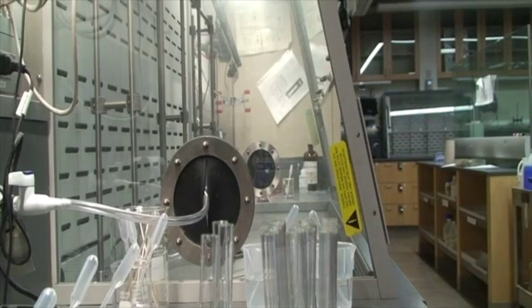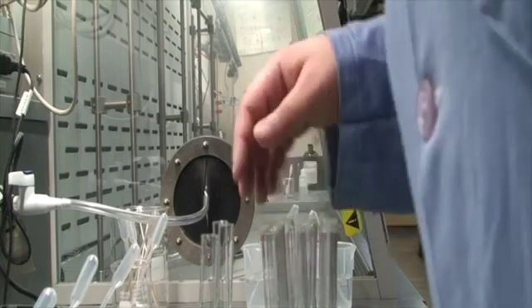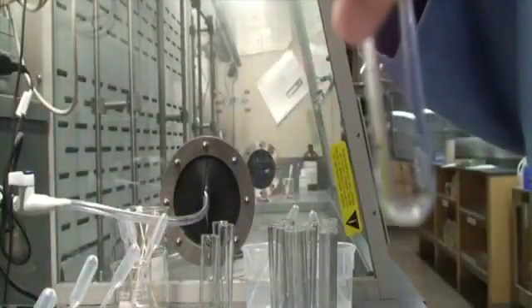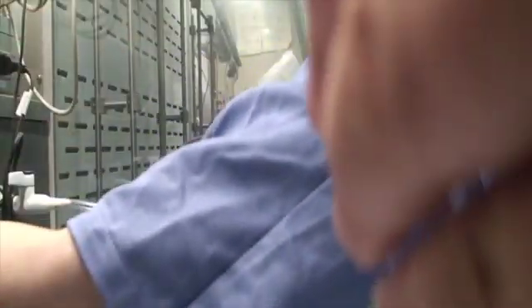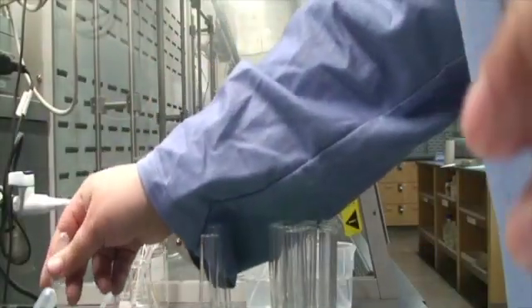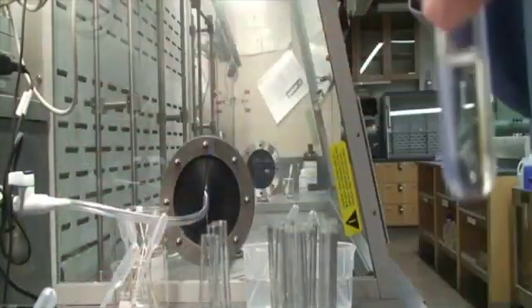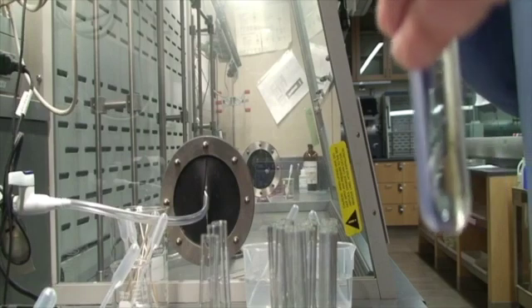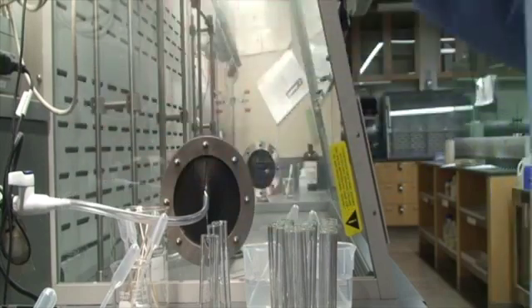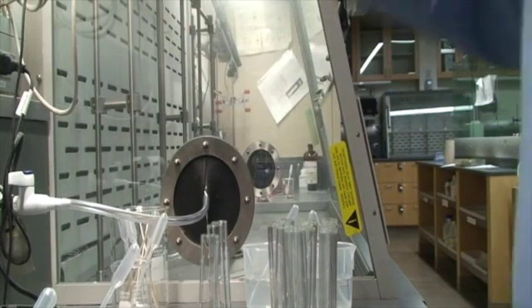Alright, we're going to do 10 and 12. Almost finished here, guys. Hang in there. So there's 10, and 12. Okay.